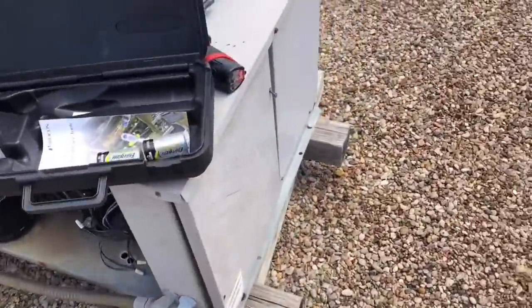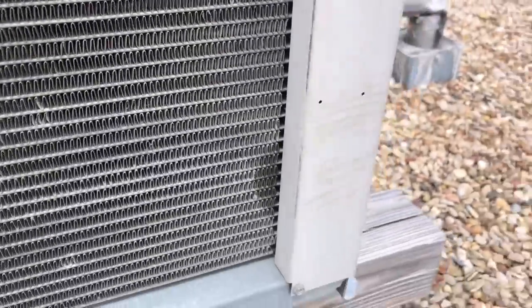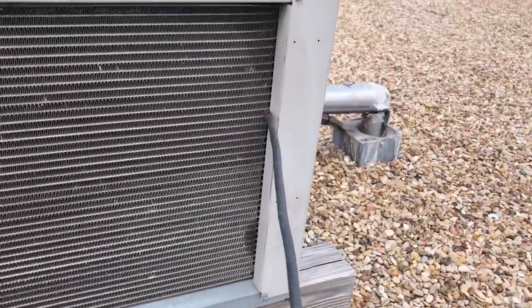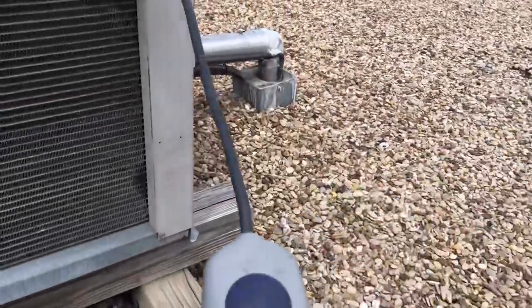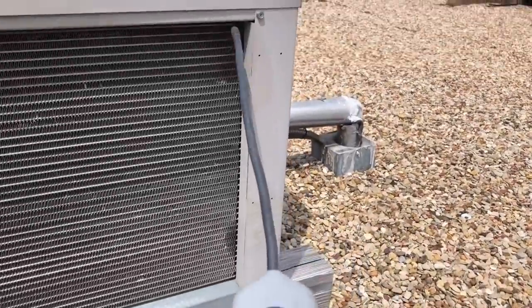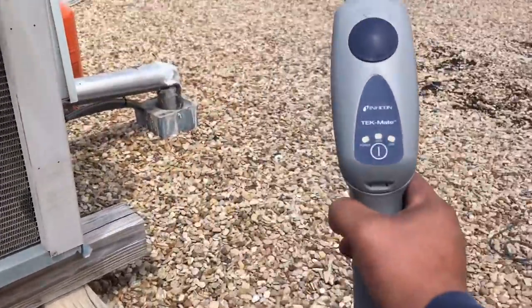Checking this whole unit. As soon as I come back here, I can already see signs of oil right there and right there. Got a leaking microchannel condenser. Let me pull it back, let it reset, and come back in and search again. Right now it is in low sensitivity — it will pick up decently small leaks. There it goes — just picked up that top one.